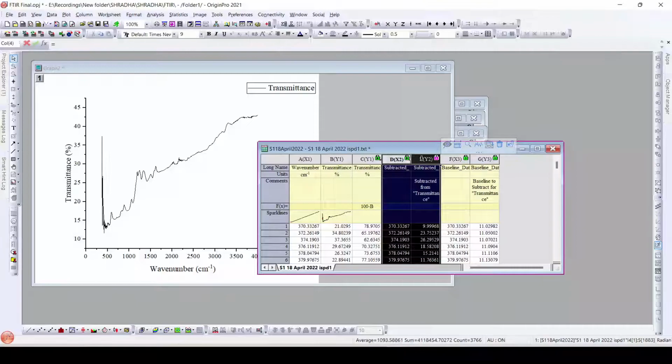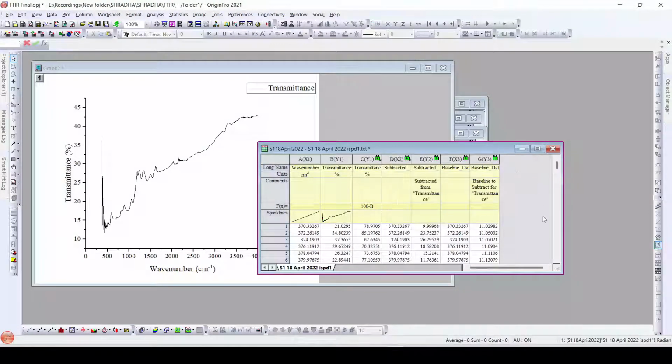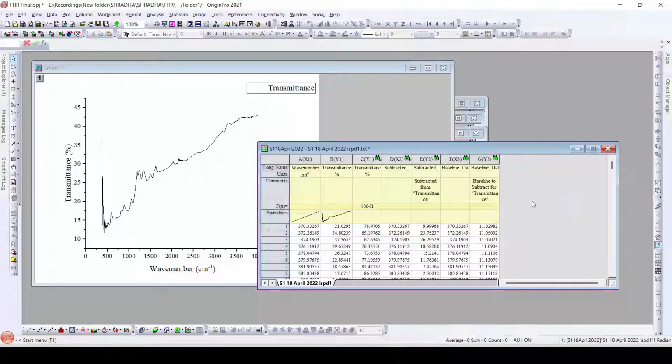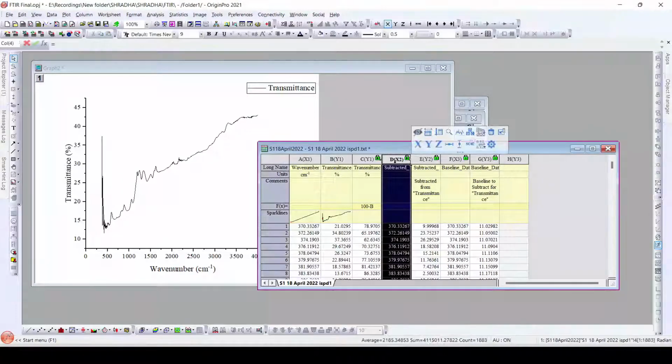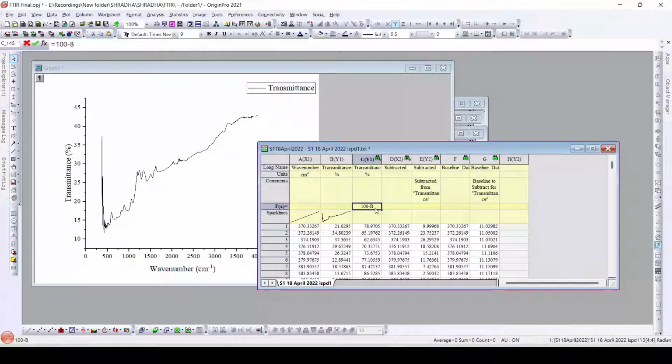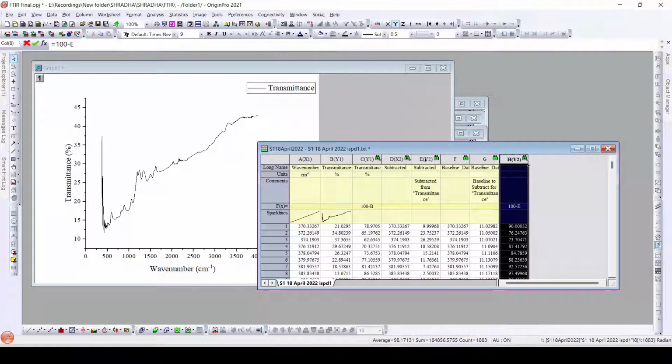Now I will disregard this. Why do we need to disregard it? Because we are going to add a new column here. Once we add a new column here, it is Y3, it should be Y2, because we should use the X2 axis for this. So I will disregard this baseline, and here this is now Y2. The same thing that we have to do is just click 100 minus the E column. So this is the data that we require, and this is the column.